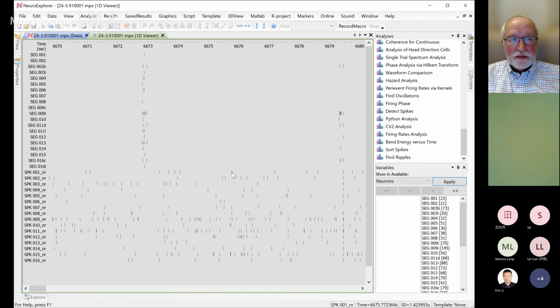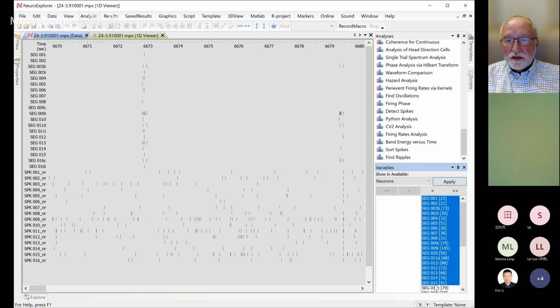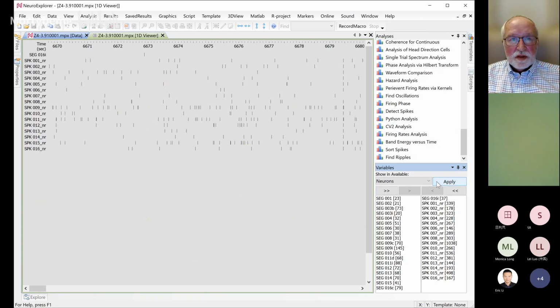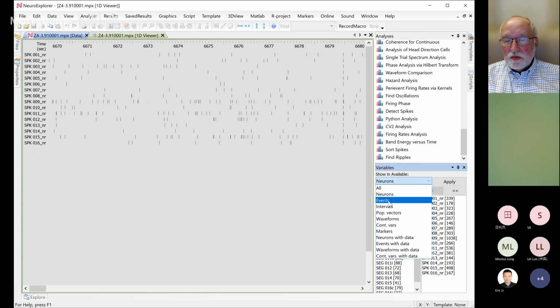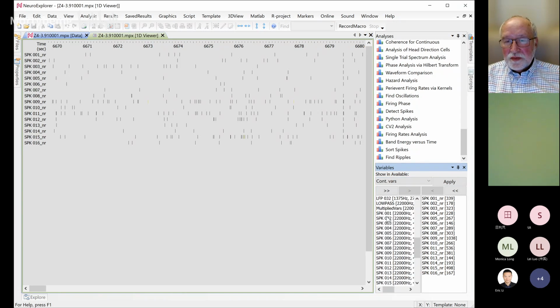Can we see the continuous signals in color? In the continuous, like in the 1D viewer, there's a signal. Okay, so in different colors. Let's remove the old spikes, just so we have these ones, and we can show, for example, continuous variables here if you want to look at them.